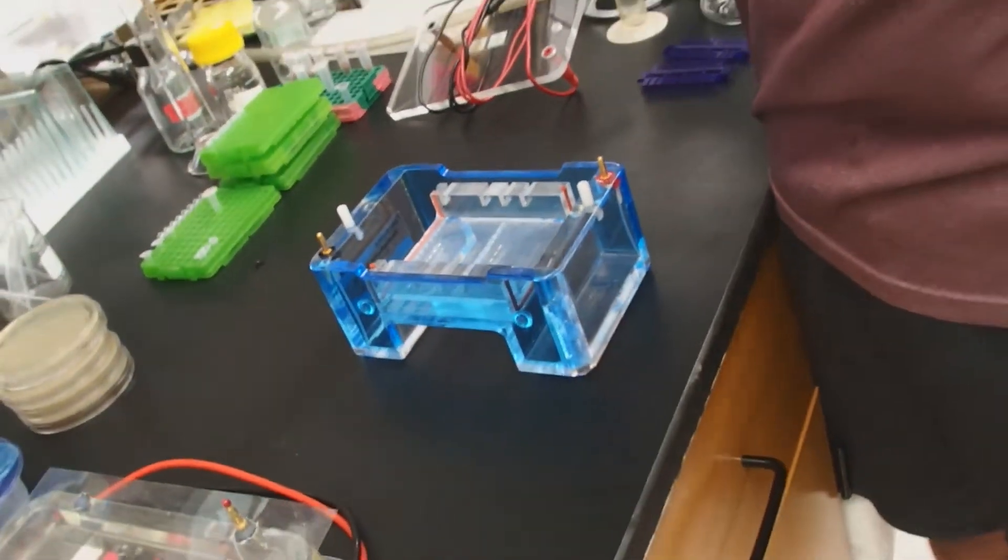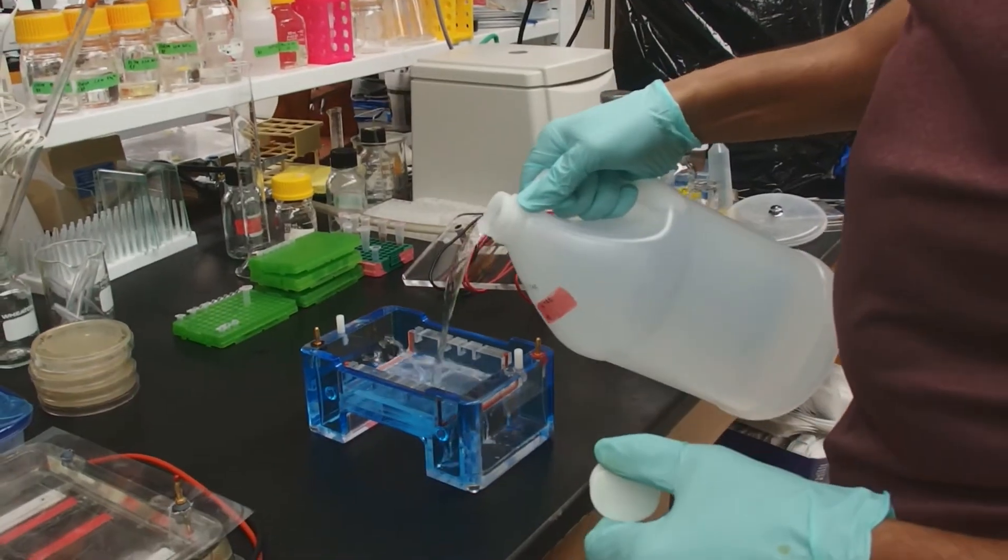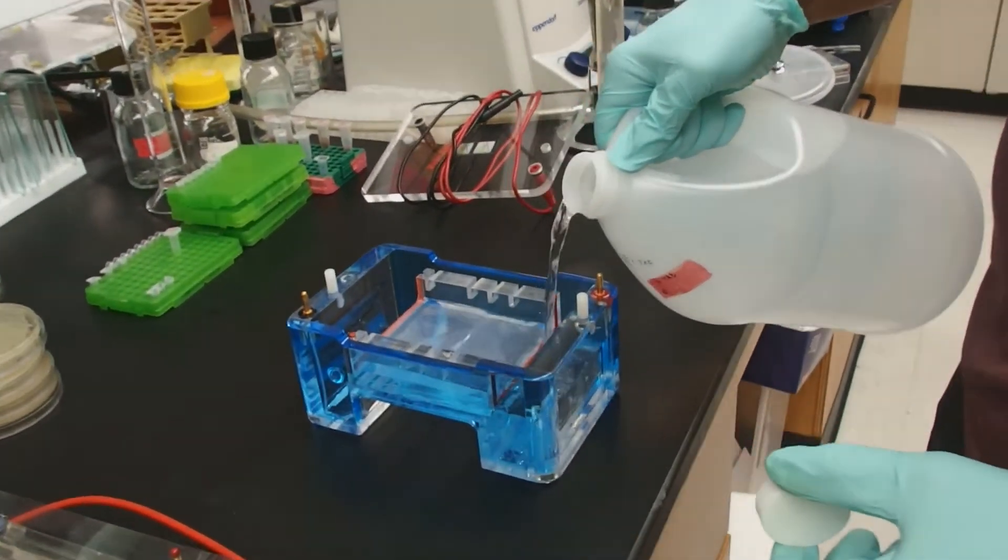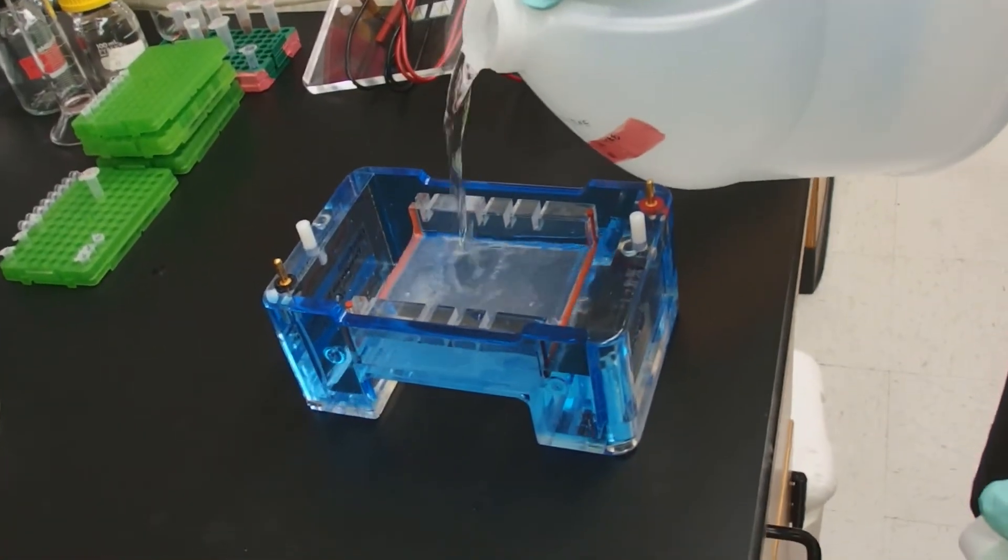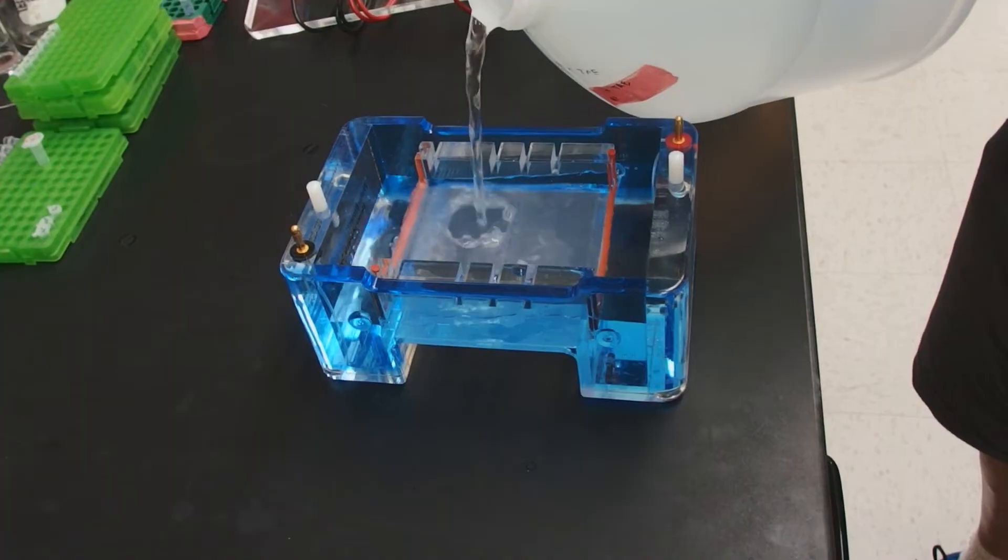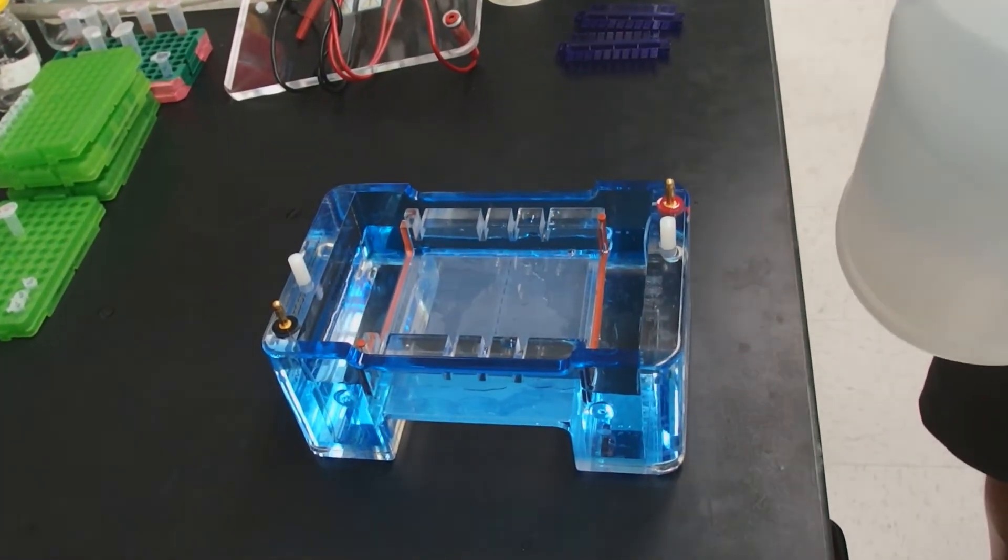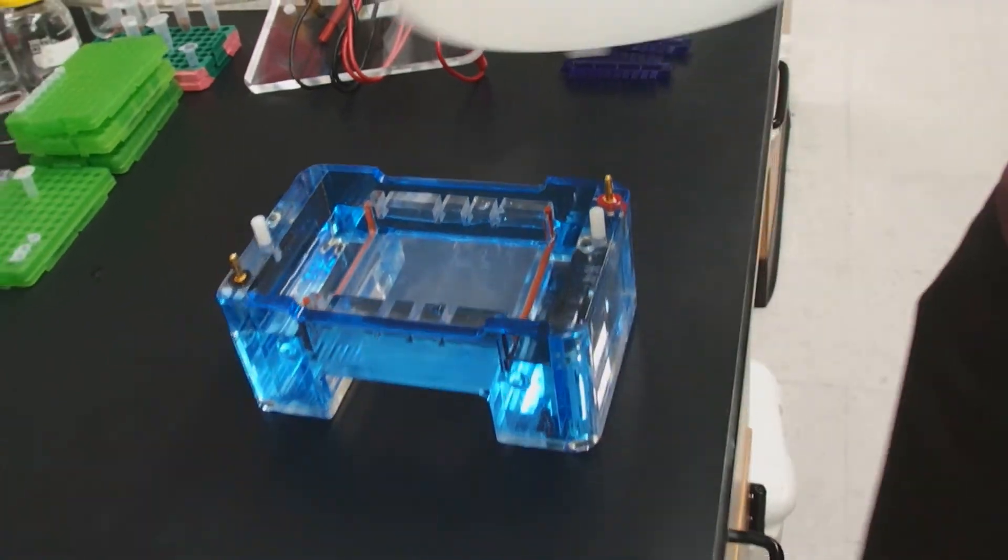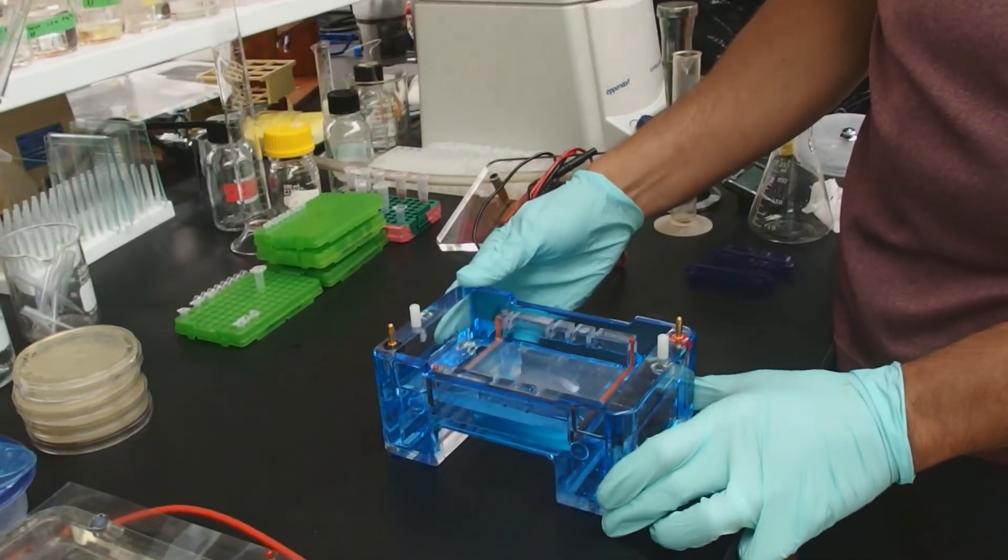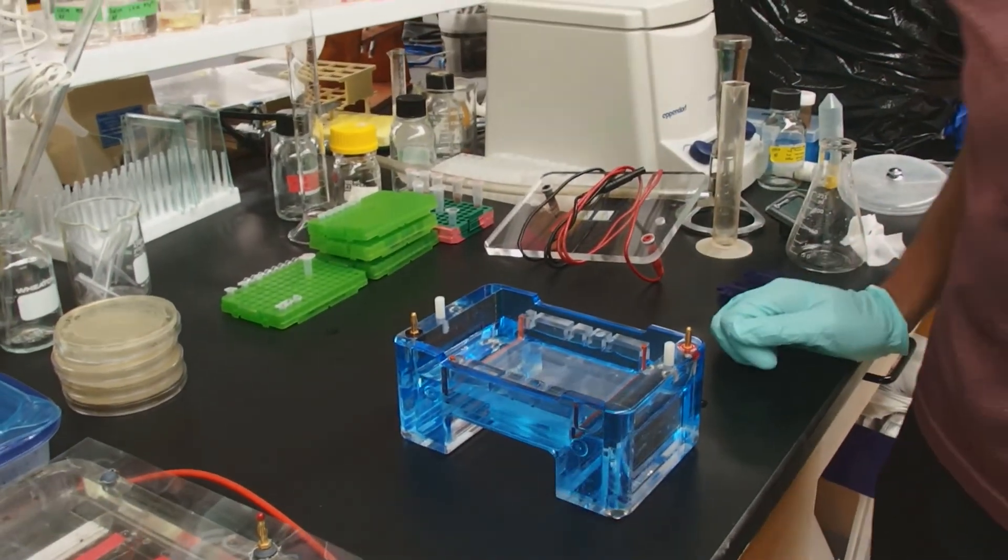You're going to fill the system with TAE buffer. Carefully pour TAE buffer into the gel. And the goal here is to fill it, but not overfill it. So we would like to have just like a couple milliliters on top of the gel. That's where we'll get the highest performance. The gel has to be covered, but it shouldn't be swimming in real deep liquid. Now that's ready to load and run.